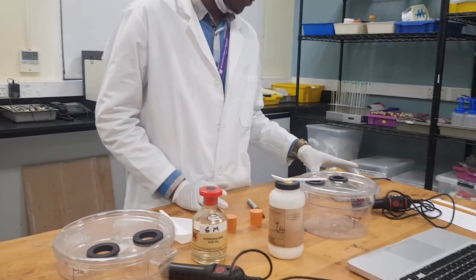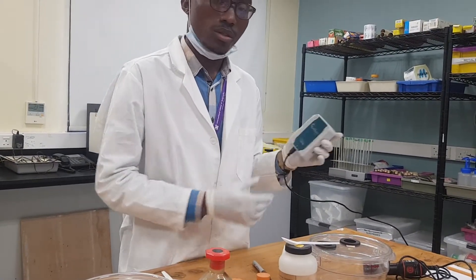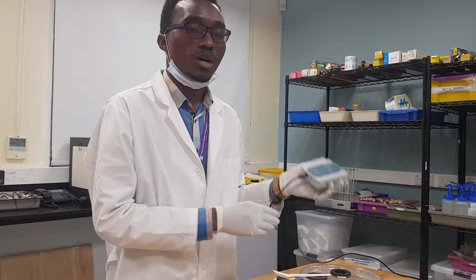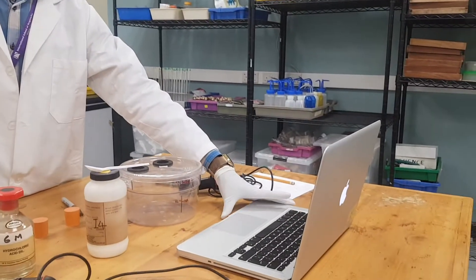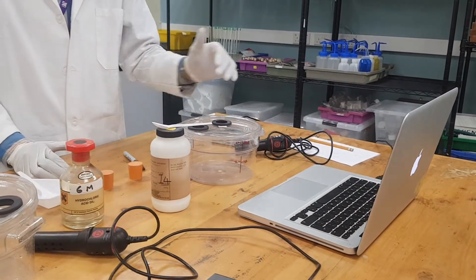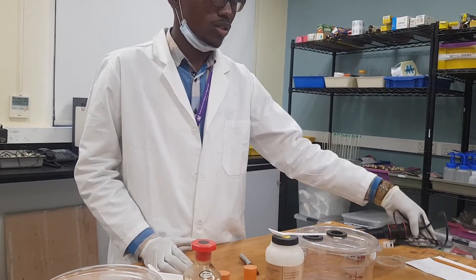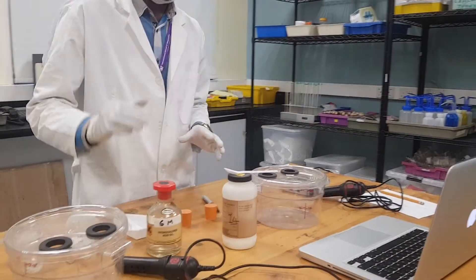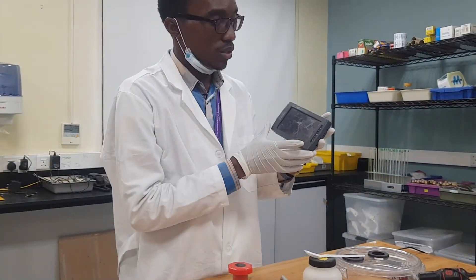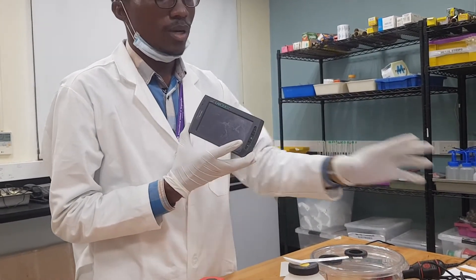We have different kinds of LabQuests which we are going to use to obtain the results. This LabQuest Mini requires a computer to use, that's why I've put a laptop here — so we're going to see our results as the reaction goes on. The probe is going to detect carbon dioxide from the reaction and display it on our computer. We also have another LabQuest — this is the more advanced one which has a display here.